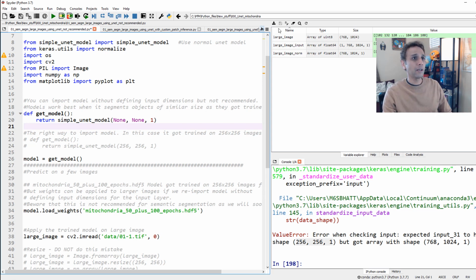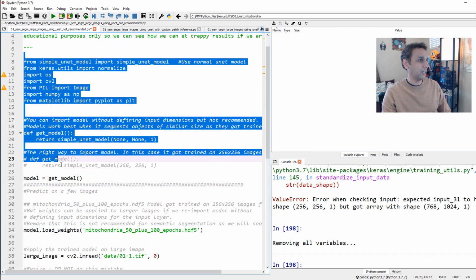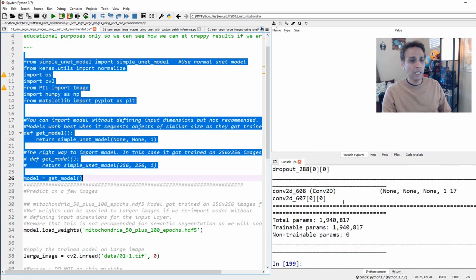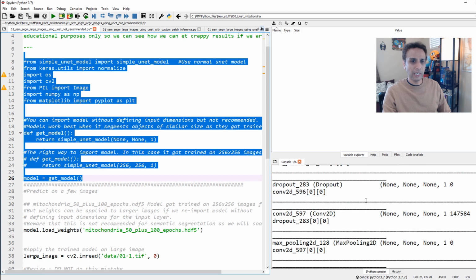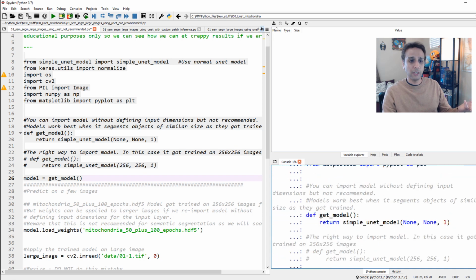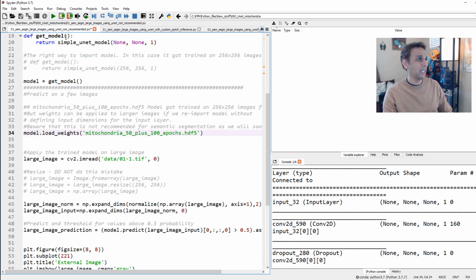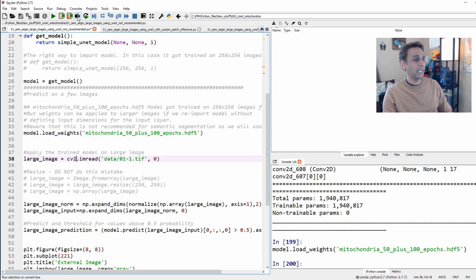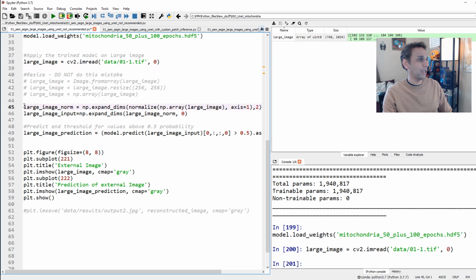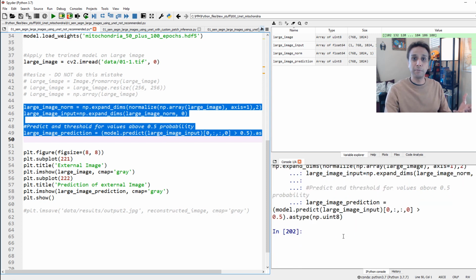So let's go ahead and remove everything that we have done until now, and run these lines again all the way up to here. And if you look at the model now, it should say none, none, and channel 1. So now it actually takes in those values based on my inputs. If I go all the way, you see none, none, none, and 1. That means it will let me run this instead of throwing an error. So if I actually load the weights, it's loading the weights, okay? And if I read the image, it should get this. And let's run all of these lines, and prediction should happen, even though my image is not of the same size, because we redid this network, okay?